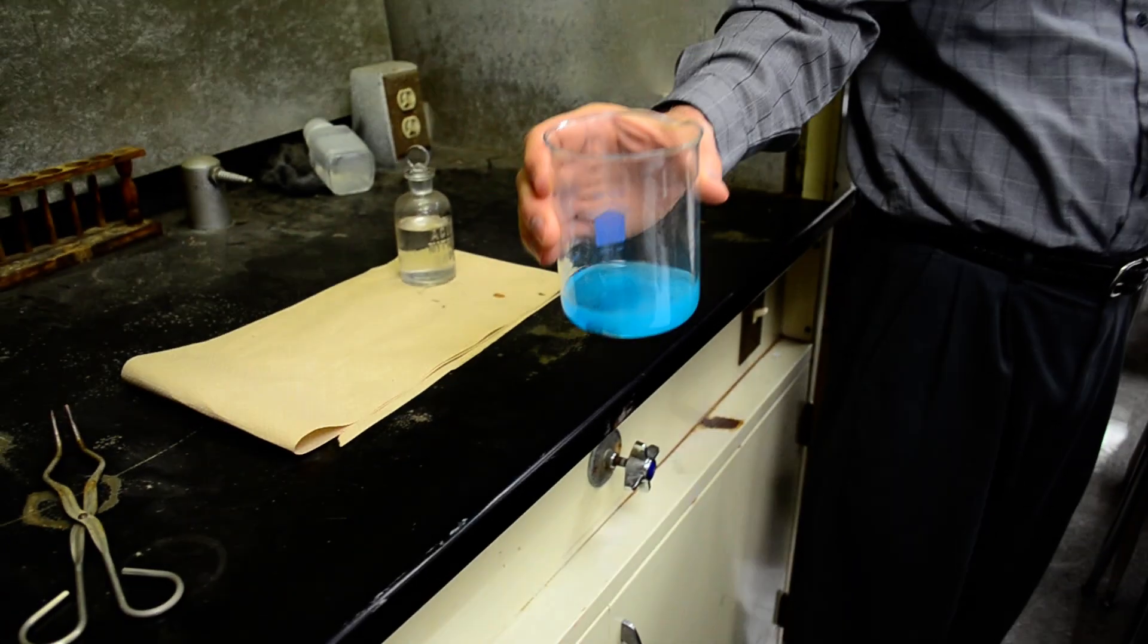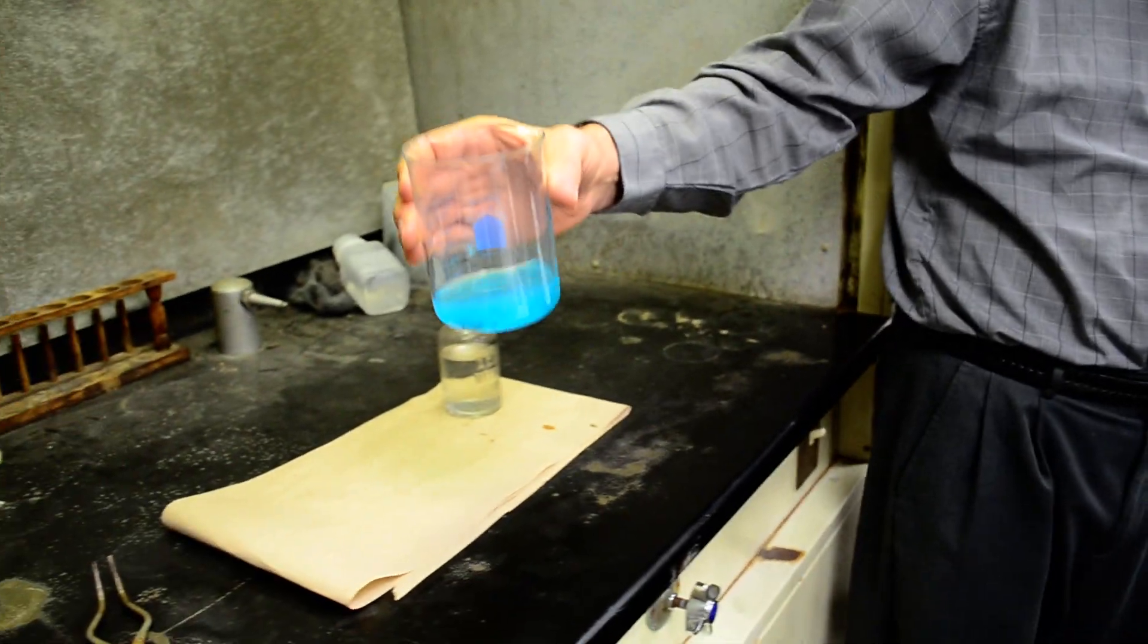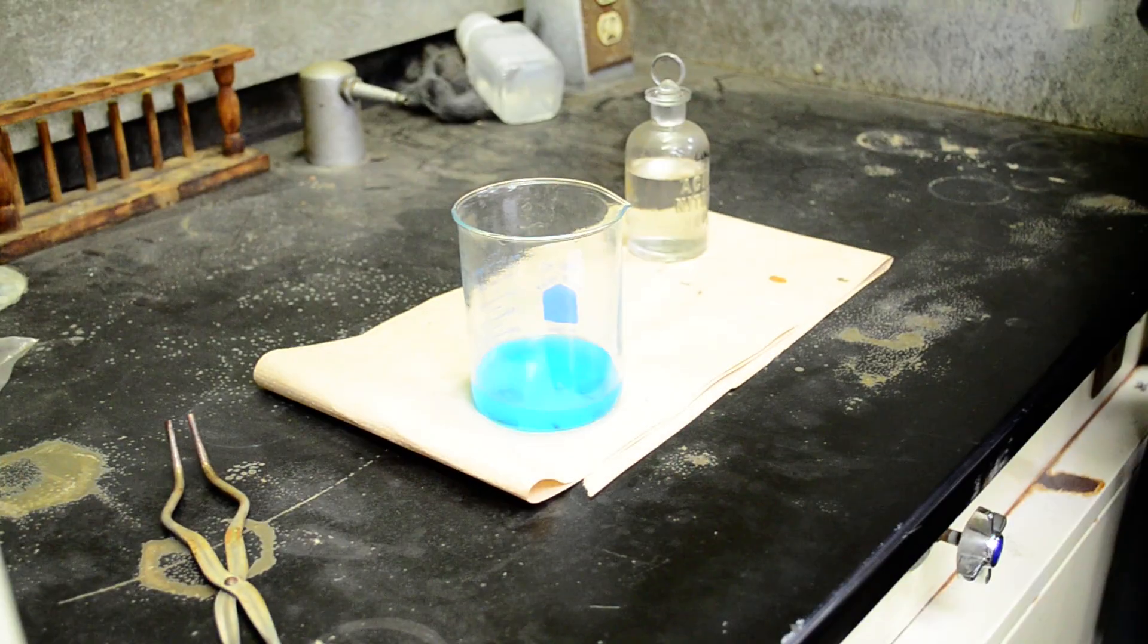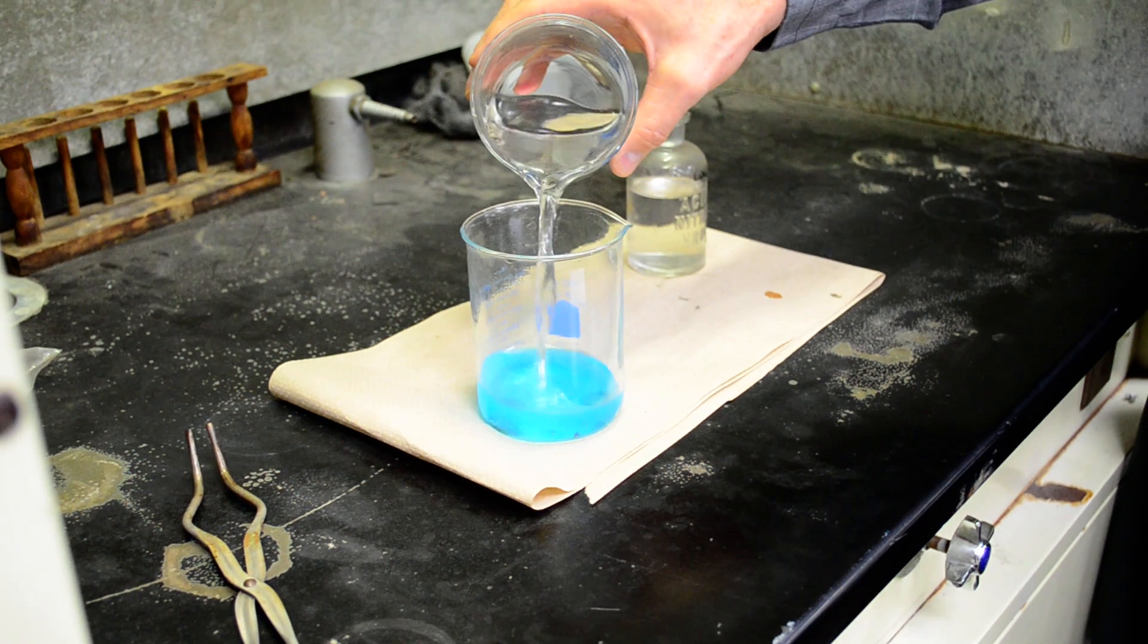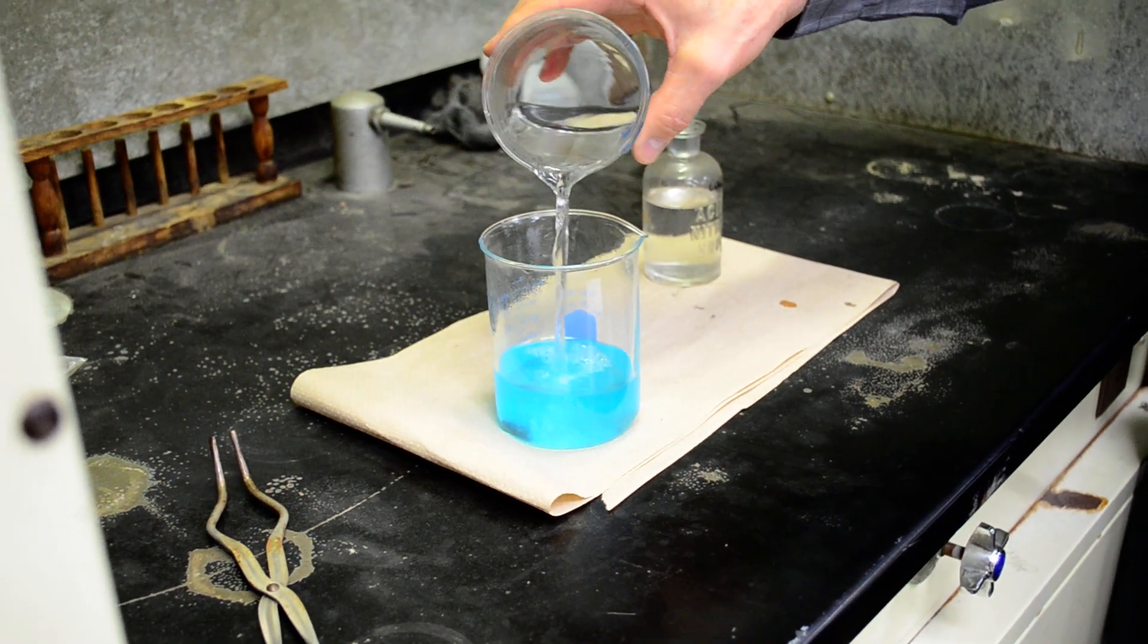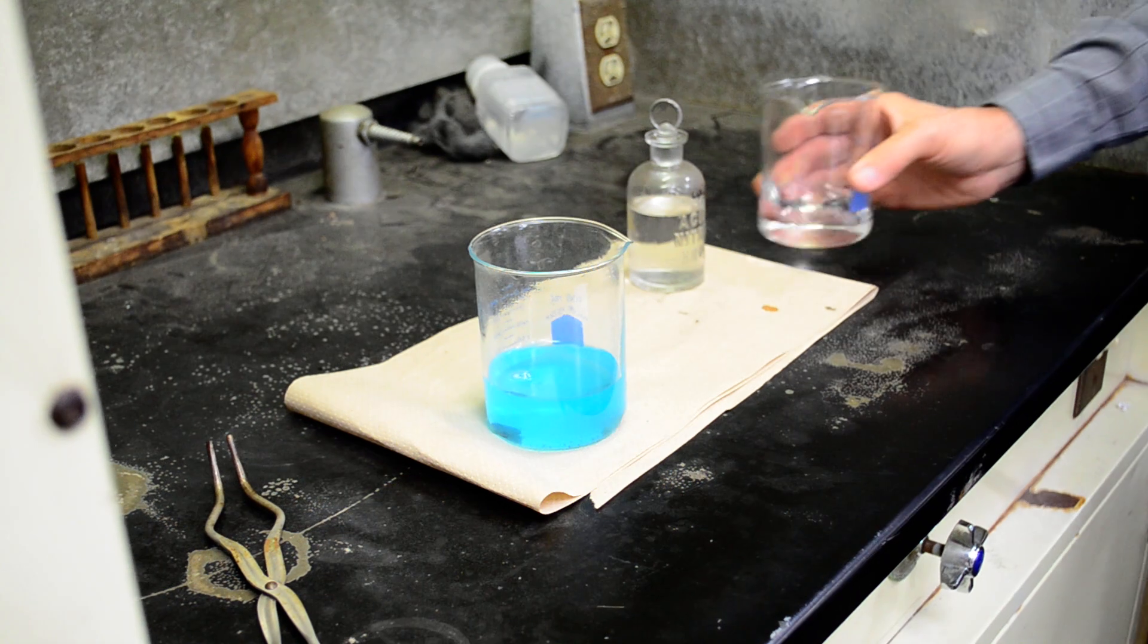Boy, that's still coming out. It's strong enough that I don't want to... Yeah, here we go. You'll notice that the pennies look a little different now. As I dilute that, the copper ion gets a little harder and harder to see.